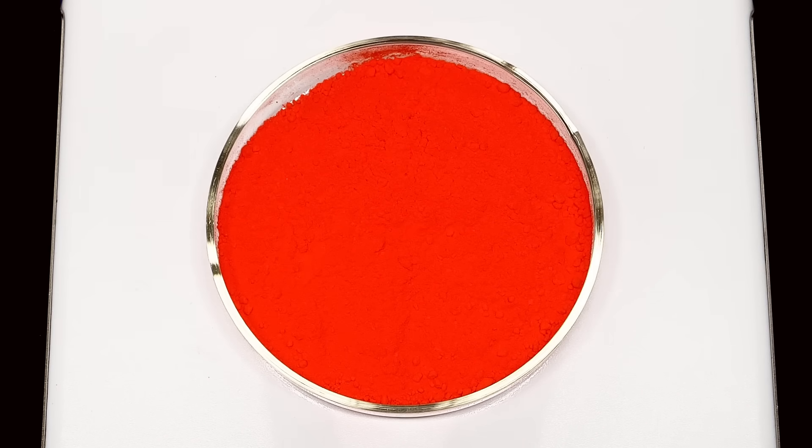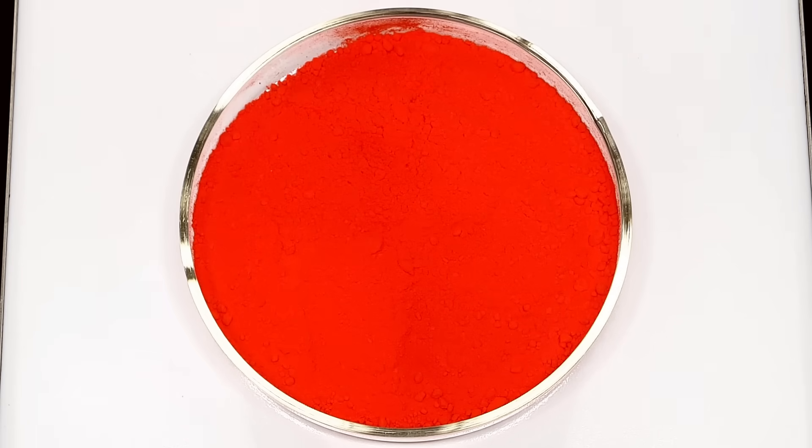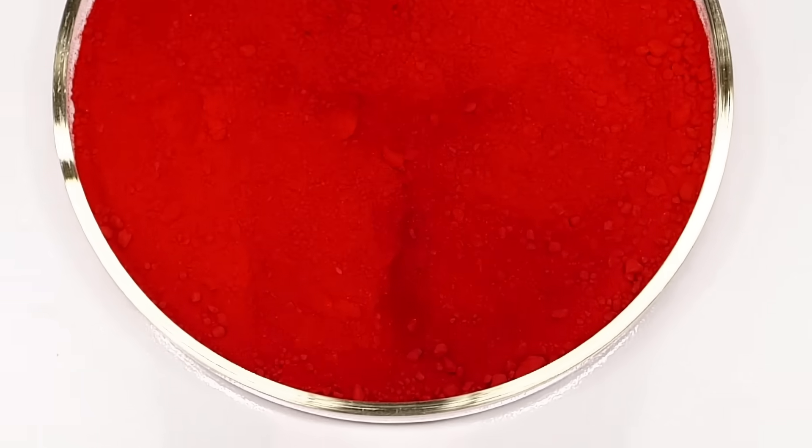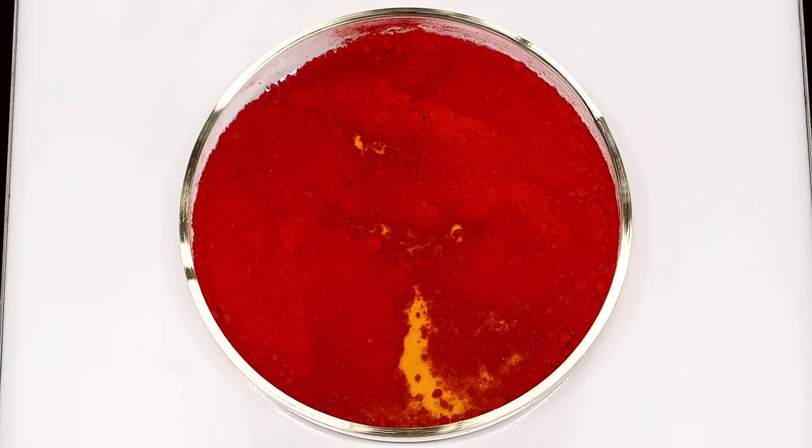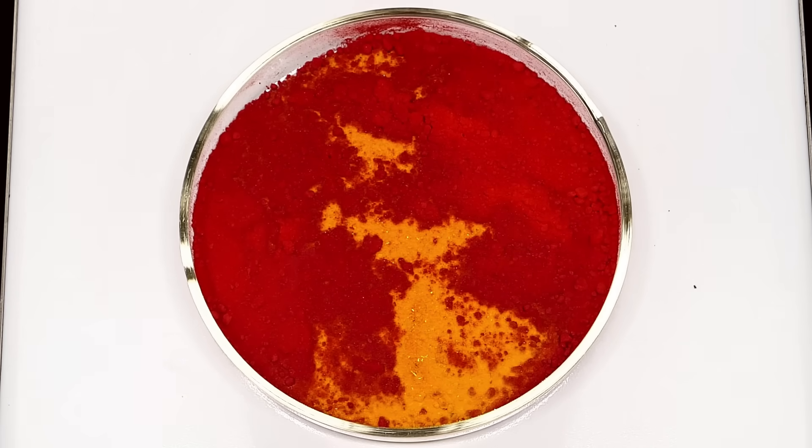I'll then put it on a hot plate and crank up the heating. As it warmed up, it slowly turned dark red, and when it eventually got hot enough, some of it started turning yellow. This yellow part then kept growing, and the red color slowly disappeared.